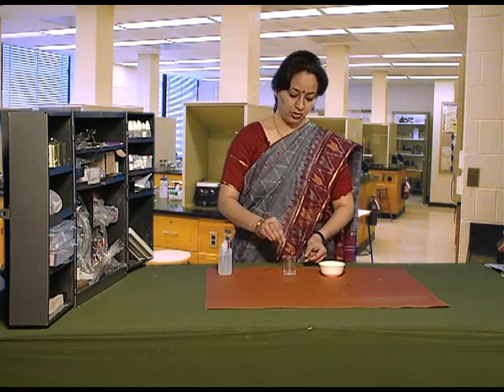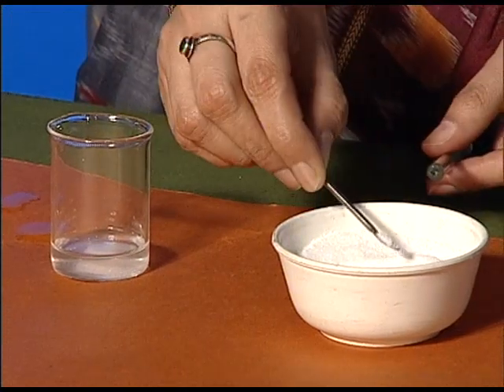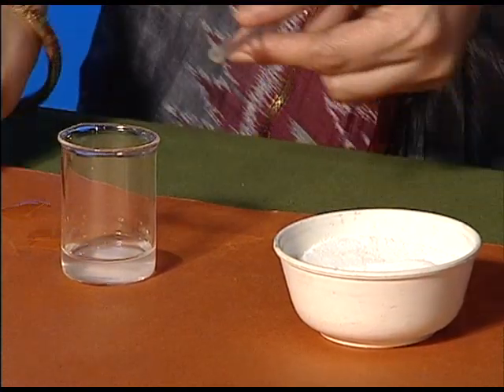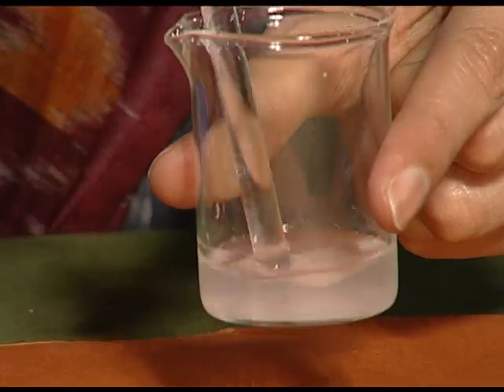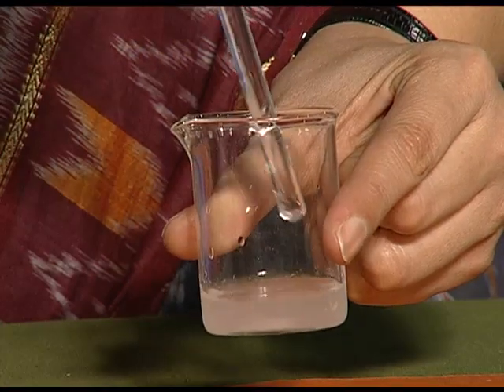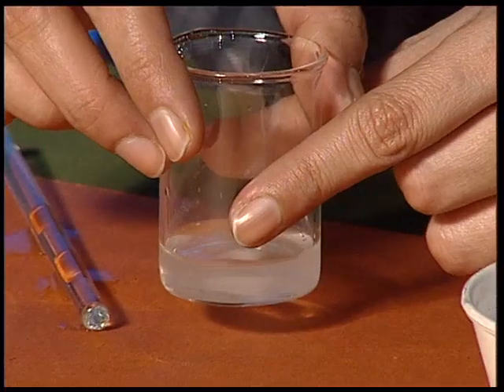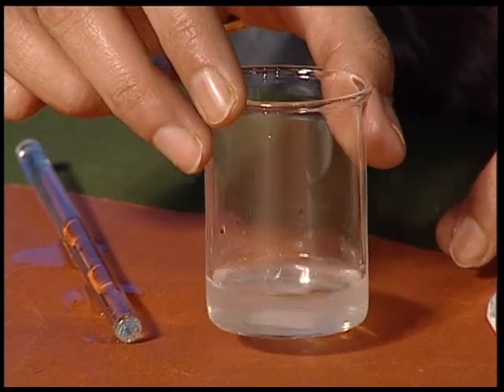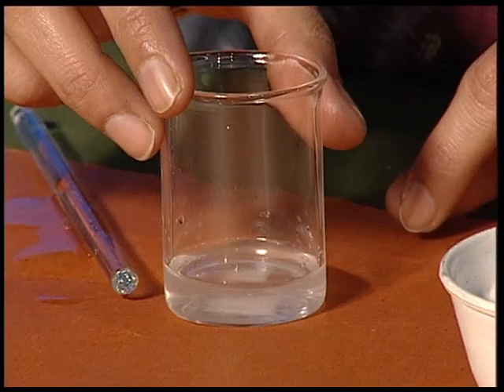Add more of common salt and stir it. Now you can see that some of the salt remains at the bottom of the beaker and it no longer dissolves in water.